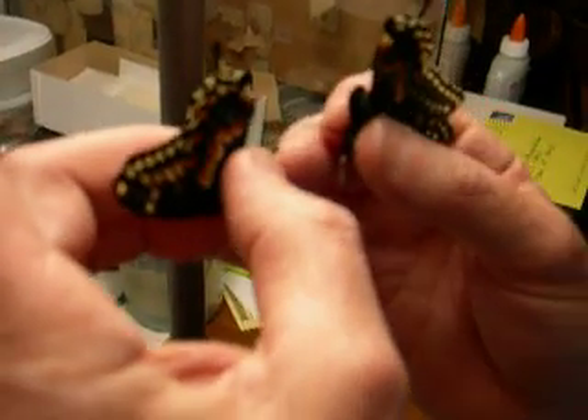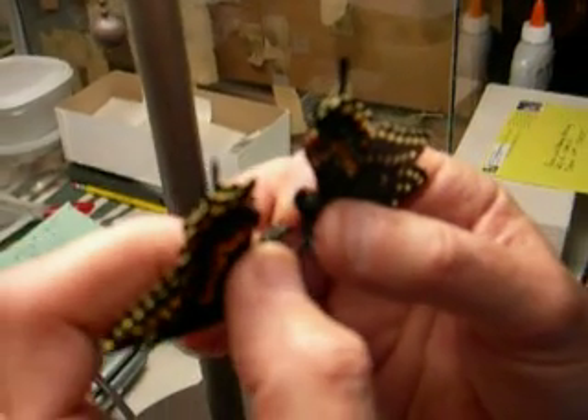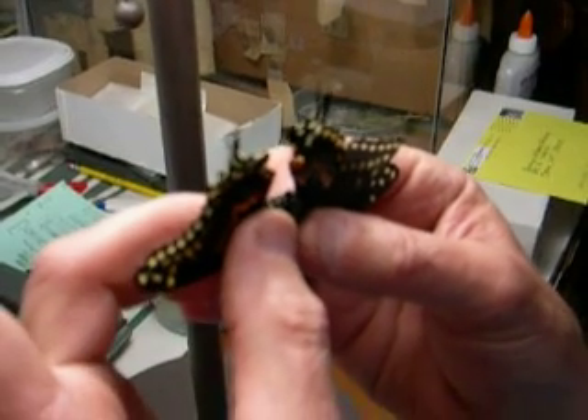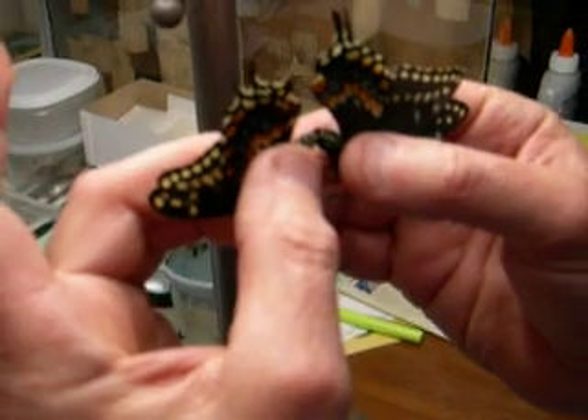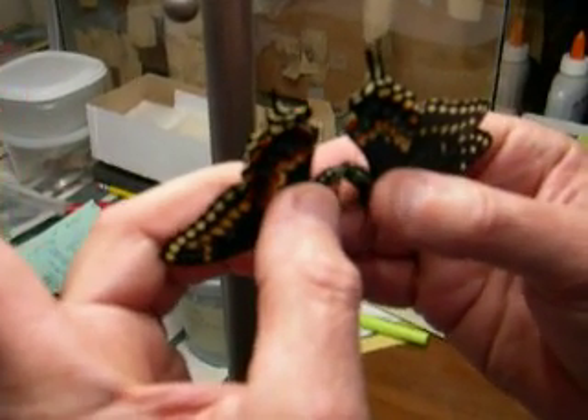Well, she's pretty upset right now, that's for sure. If you can see, the claspers are starting to open. Come in. I'm going to move the camera back, come in at an angle, about like that, and work it — and he's already, looks like he's taking hold already to me.